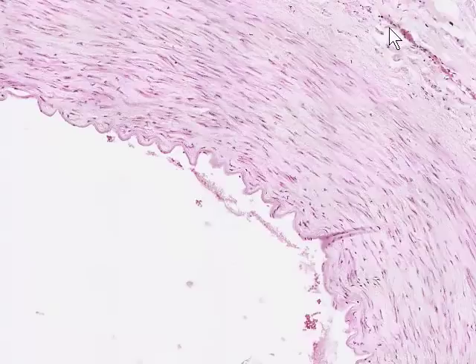And finally out here we have a tunica adventitia, which is a layer of loose to moderately dense connective tissue. If you hunt around on the edge of the vessel, you'll see it also contains other smaller vessels like arterioles and venules, and it blends with the connective tissue of surrounding structures. So it's difficult to say exactly where the tunica adventitia of the vessel ends and where other surrounding connective tissue structures begin. But it should be pretty apparent to you that the thickest part of the wall of the artery is the tunica media, extending from here to here, composed of circumferentially oriented smooth muscle.